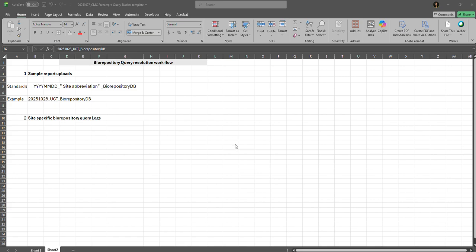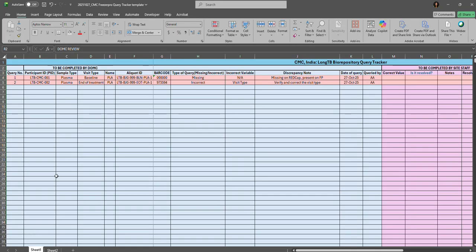Now let's talk about the biorepository query generation and resolution workflow using the query log. A generalized query log with all previous and outstanding biorepository queries will be maintained for each site throughout the study conduct. The logs are site specific, and each site can access their log through the shared with sites folder on box.com.